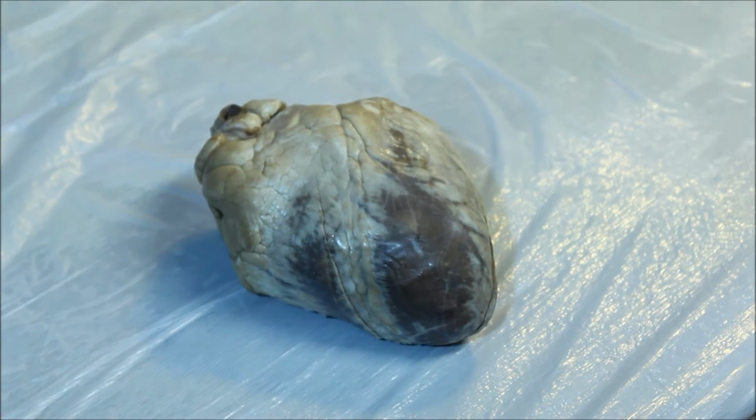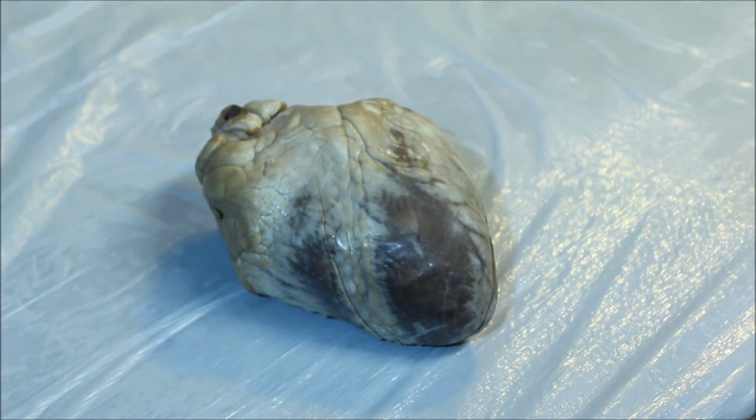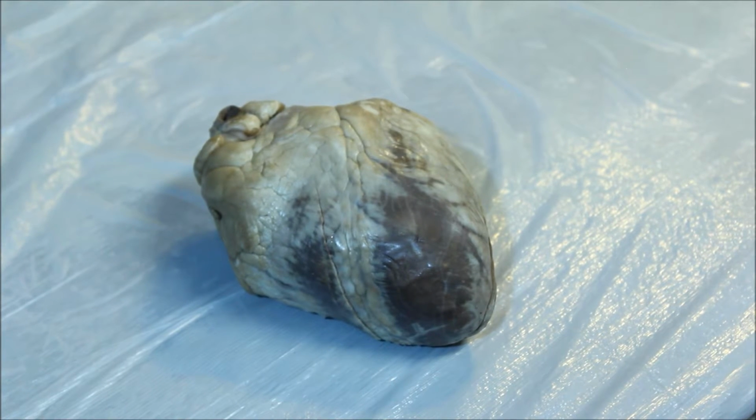Hello, my name is Lucretia Cornell, aka Tam, and this is my video on sheep heart dissection and anatomy identification.